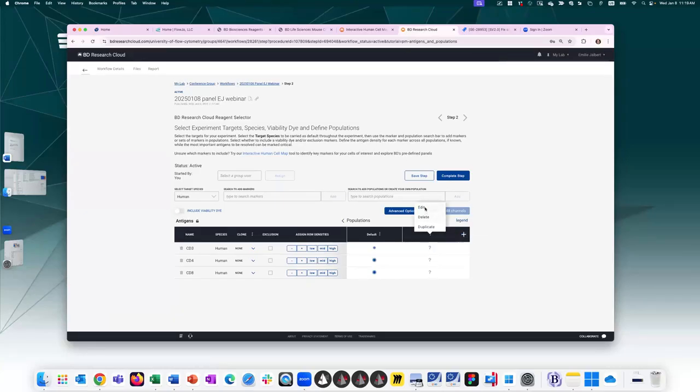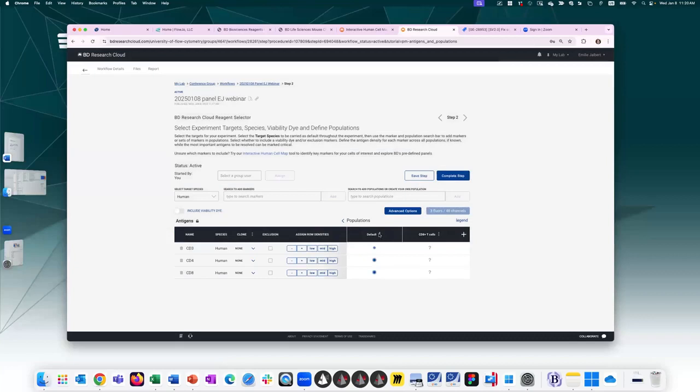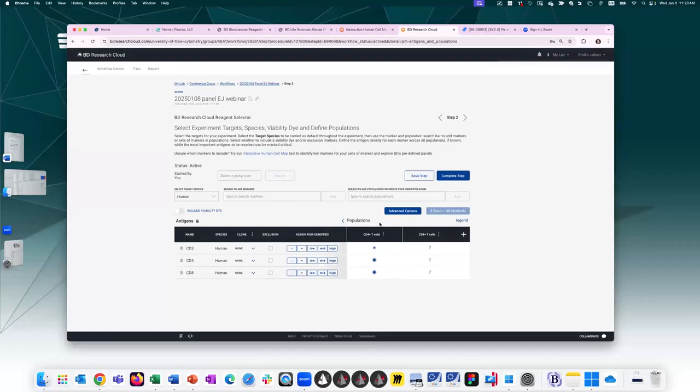So let's go ahead and rename this one CD8 positive T cells. Submit. I'm going to rename this one instead of leaving it the default population. I'm going to rename it CD4 positive T cells. And so now I can assign population-specific antigen density that's relevant to my downstream gating strategy. So in this case, CD4 and CD8, they both have the same antigen density value, so I'll assign CD3 mid to both of them. CD4 marker is high on CD4 T cells, but it is negative for CD8 T cells. And CD8 is now negative for CD4 T cells and positive or high for CD8 T cells.